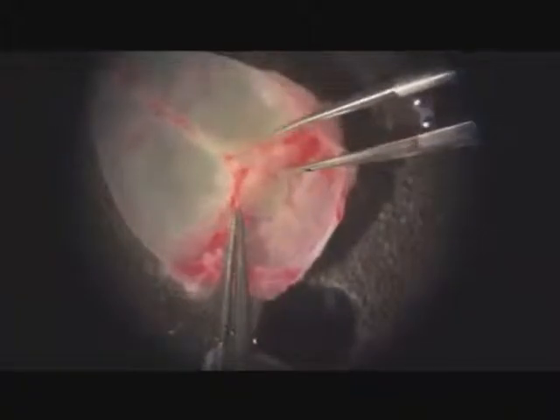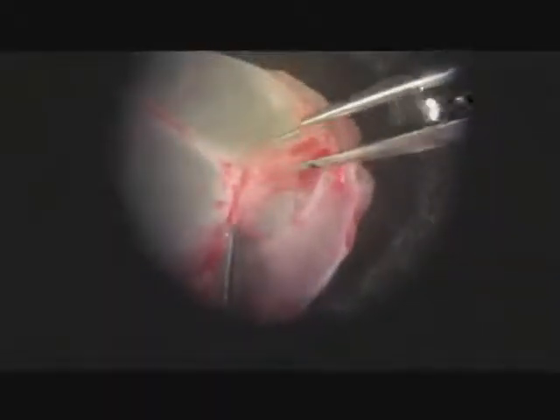As mentioned, there are three points that the pineal is connected through connective tissue. These connective tissue attachment points can be removed with fine-tipped forceps, carefully, one at a time. This is especially important if you're going to dissociate cells, because you don't want pineal cells contaminated with connective tissue cells. After all three points are disconnected, the pineal can be picked up and removed from the skull cap.